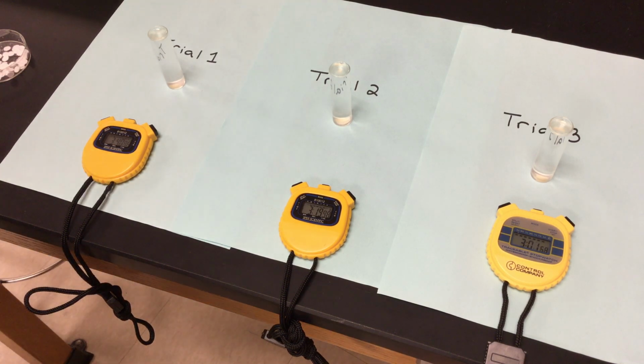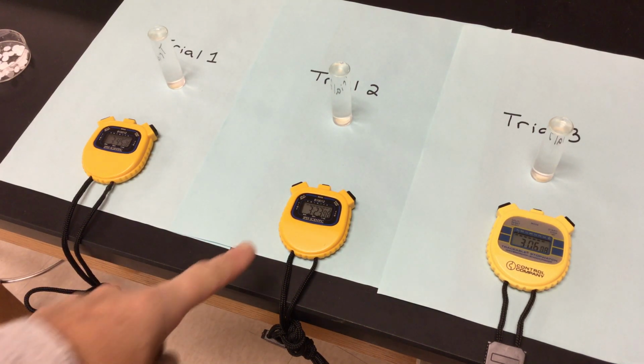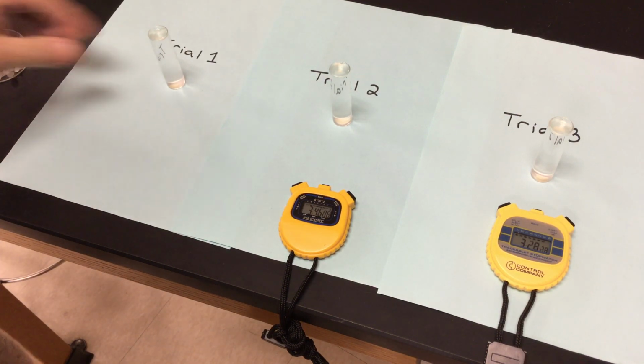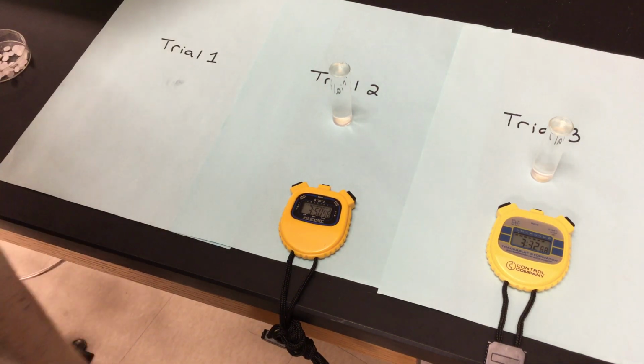So we have our yeast in there with the catalase in there. And we're at 3:40 right now. We still have no action on our pH of 3, 3:25, and 3:06. So we're going to be calling this here in a moment. 3:50, we're going to say our maximum time is 4 minutes. So we're going to call the first one 4 minutes. So trial 1 for pH of 3, 4 minutes. I'm going to dump it out in my waste container so that I'm good to go with my next round.